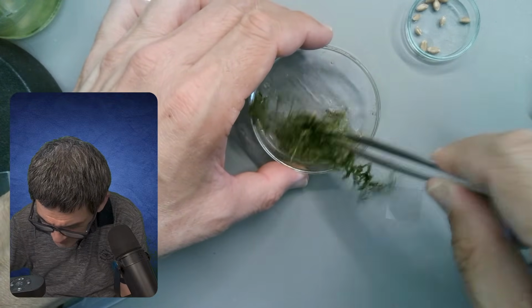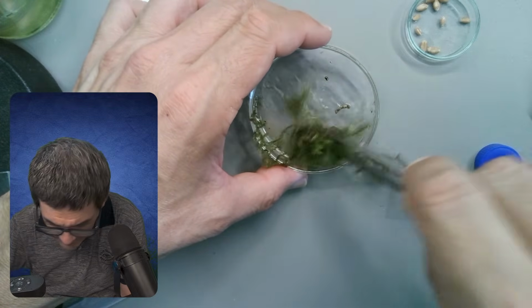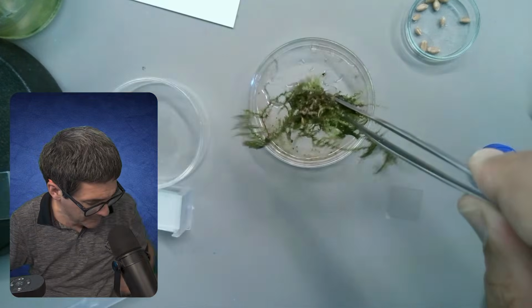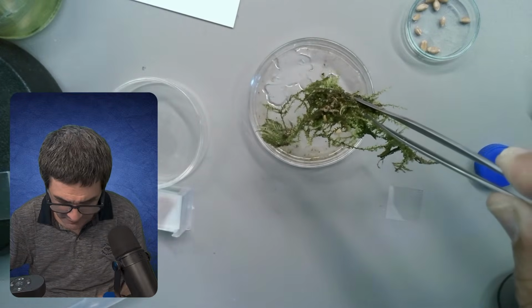But because we've not seen a lot before, I'm not very confident here either. But just put the rest back.